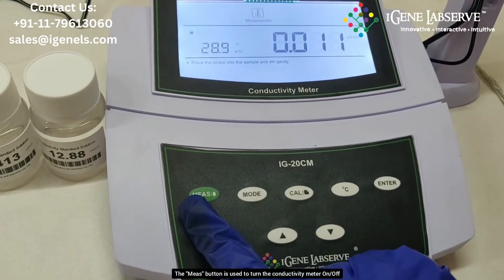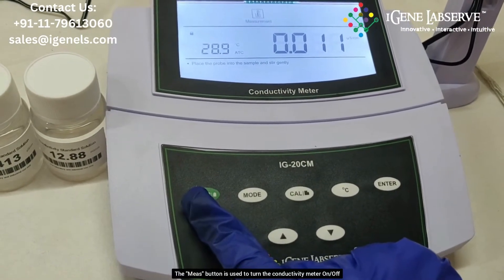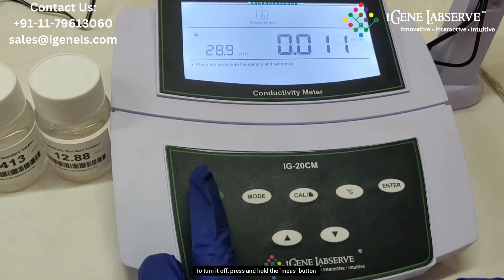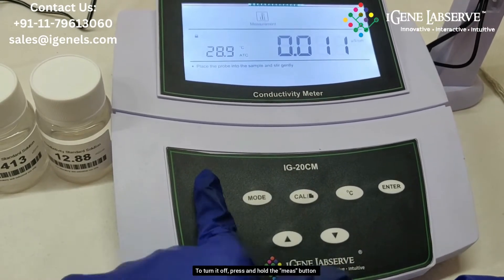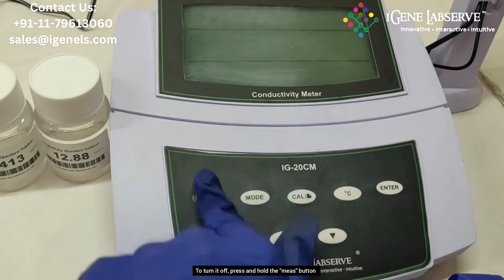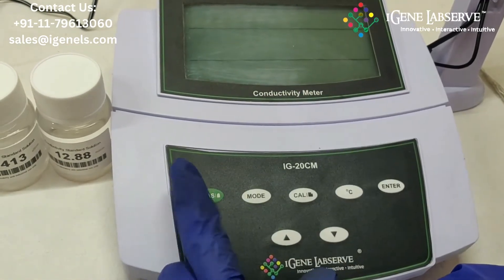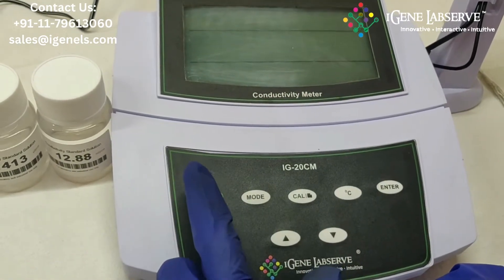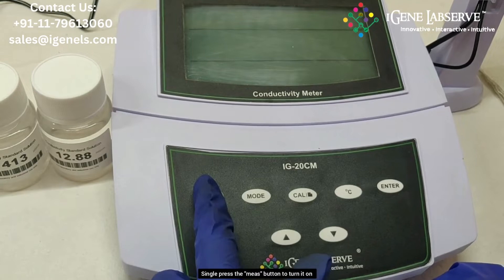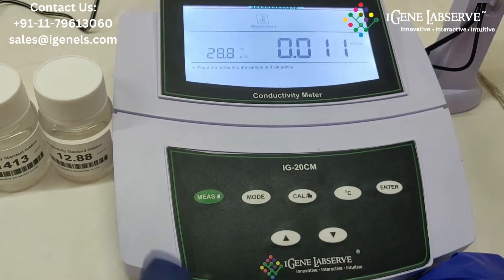The first button is the measure button, which is used to turn the machine off — you have to press and hold it. To turn it on, you single press the measure button.